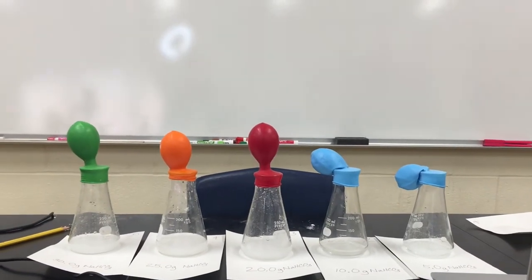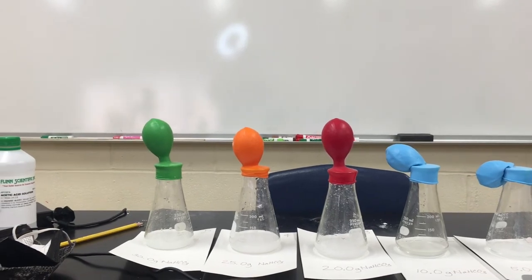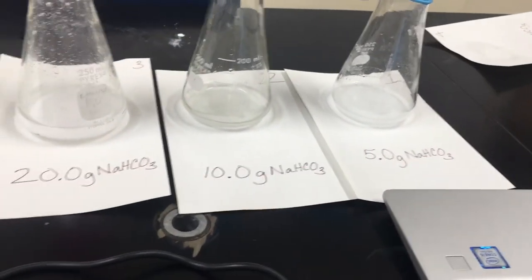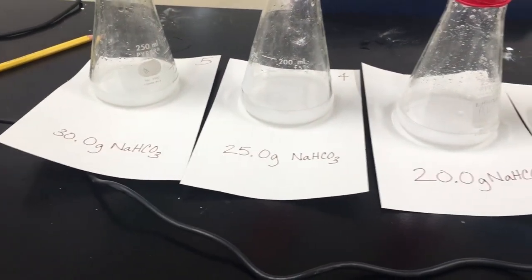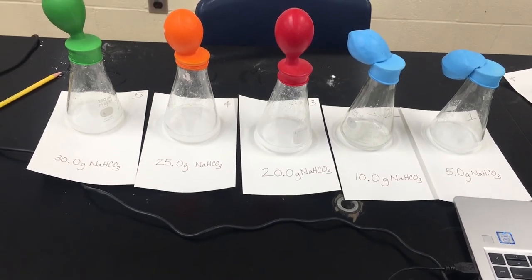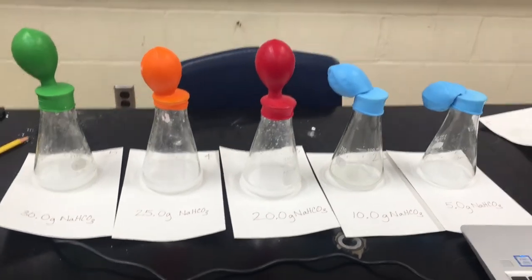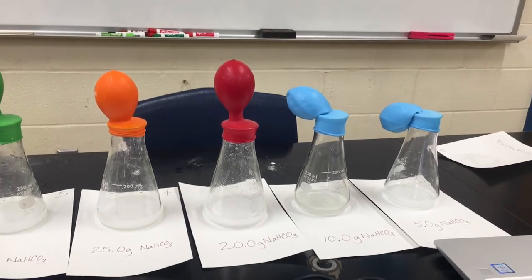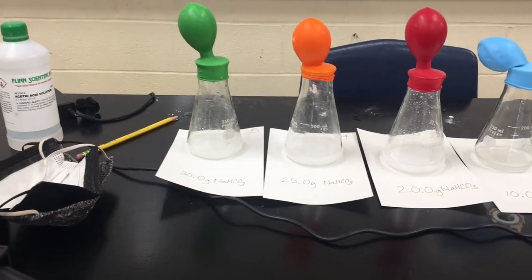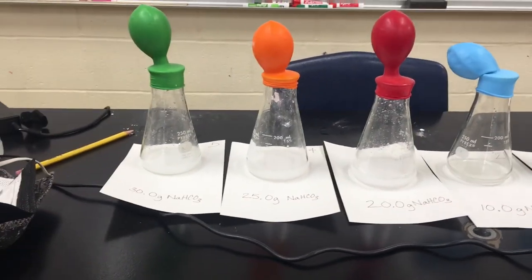Here we have our finished reactions. You can see that balloons 1 and 2 have not completely inflated, but balloons 3, 4, and 5 have inflated about an equal amount. Each of our flasks contained a varying amount of sodium bicarbonate or baking soda. Flasks 1 and 2 appear to be pretty clear with no excess baking soda left over, whereas flasks 3, 4, and 5 appear to have some baking soda remaining at the bottom — less in flask 3, but more in flasks 4 and 5.